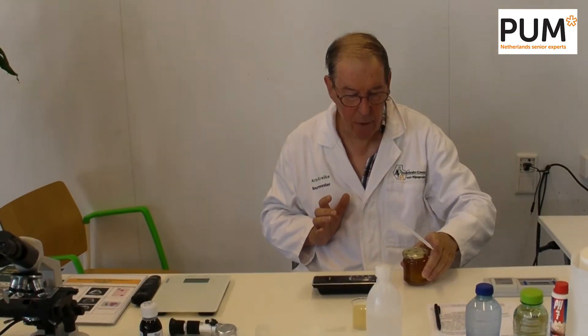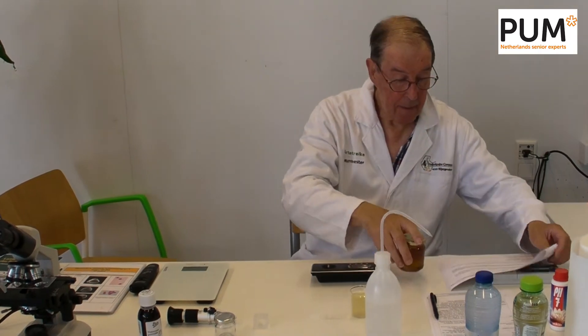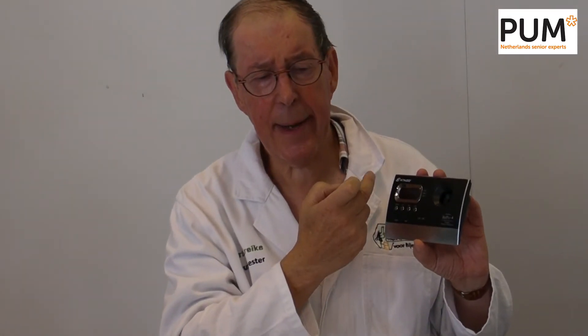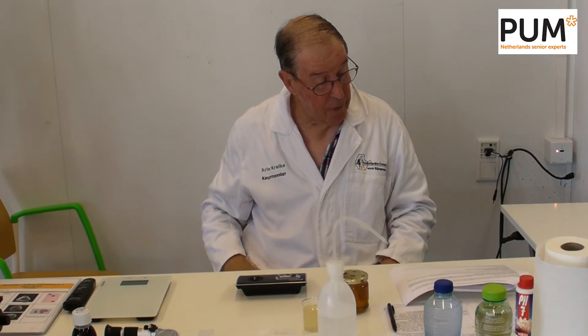Now we're going to test whether this is fraud honey, and I take my protocol script. What we have to do is use the polarimeter, the Atago Repo 4. You have to notice that Atago has a large scale of polarimeters, but you need the Repo 4 because it is manufactured specifically for honey. Other polarimeters are for other solutions. So you need the Atago Repo 4 for the optical rotation of honey. Before you can use this instrument, you have to calibrate it.